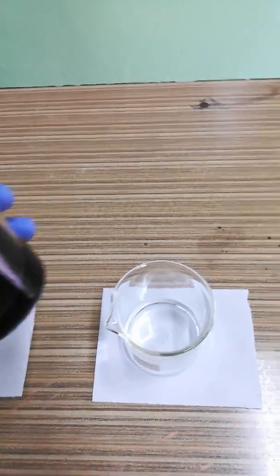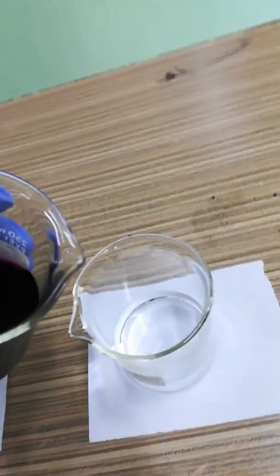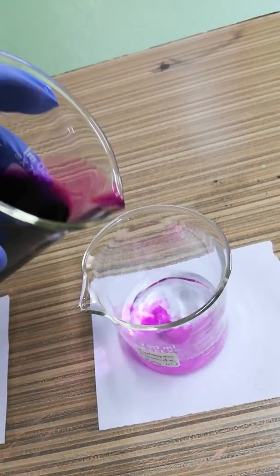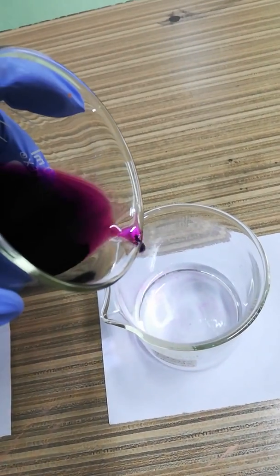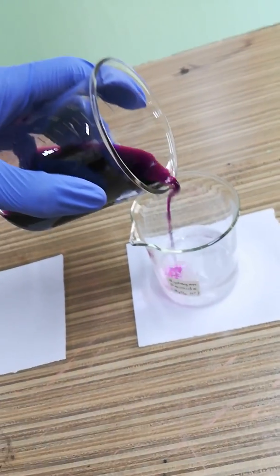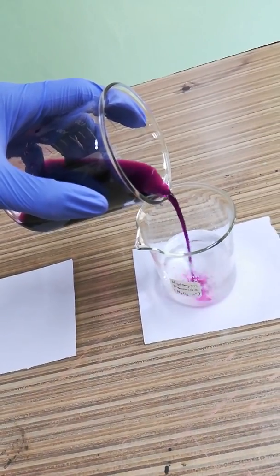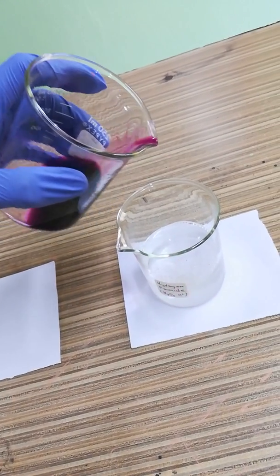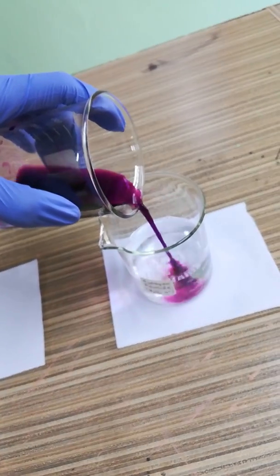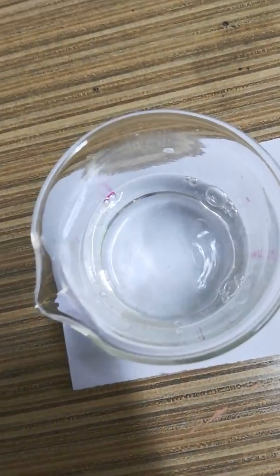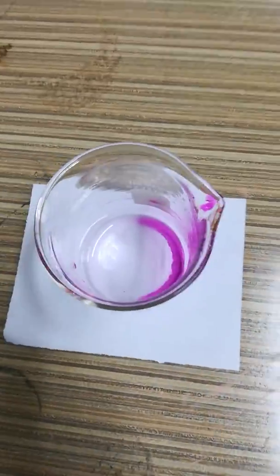Just watch as I pour it in. See, it disappears. That's very nice. Right now the hydrogen peroxide is being oxidized by the potassium permanganate KMnO4.